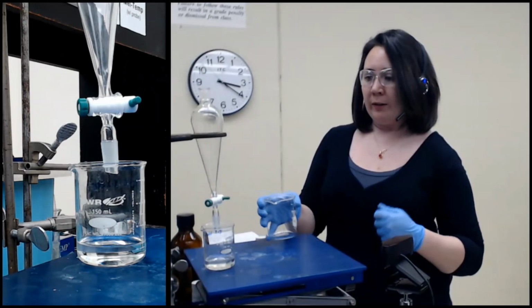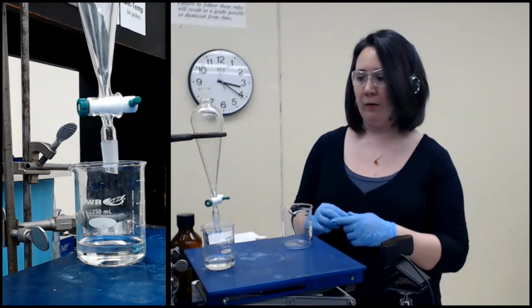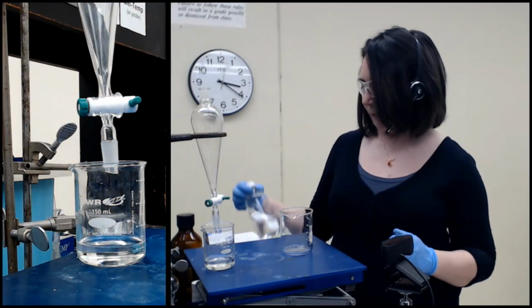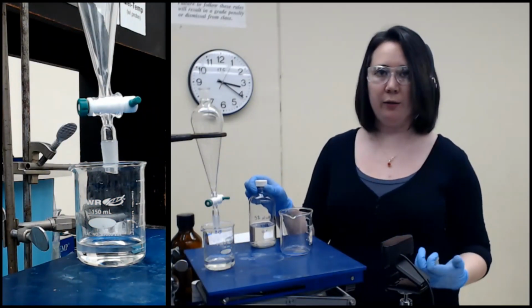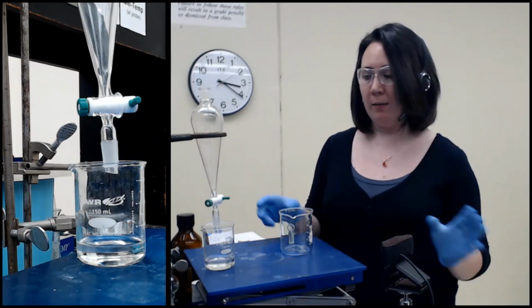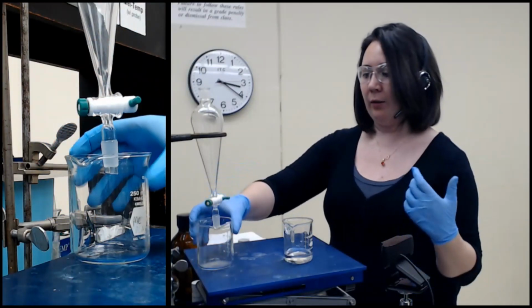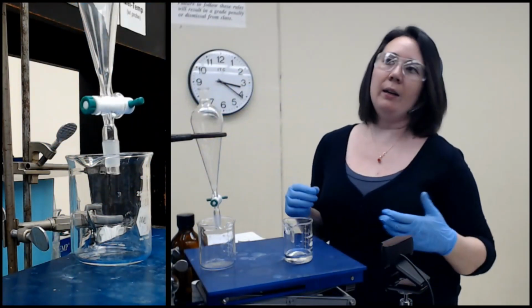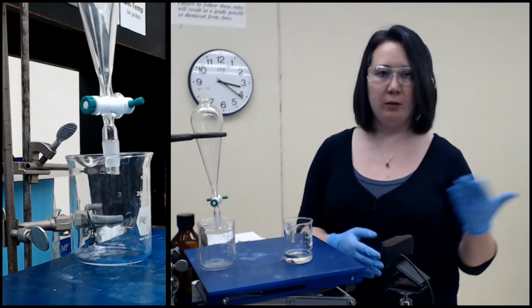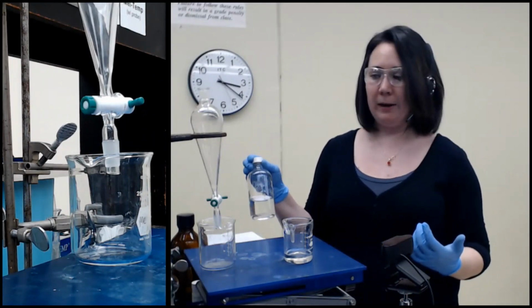Okay. So to take out our first component, well, actually our second component, because our first one is in this funnel over here, we have ethyl acetate, and I'm going to extract it with 5% sodium bicarbonate. Sodium bicarbonate, I'm going to call it bicarb as a shorthand, is baking soda. It's a weak base, so it can deprotonate a stronger type of acid like carboxylic acids, which will essentially react with something like sodium bicarbonate.